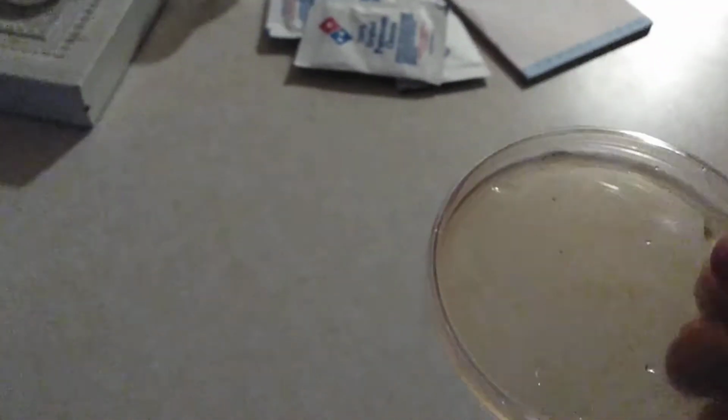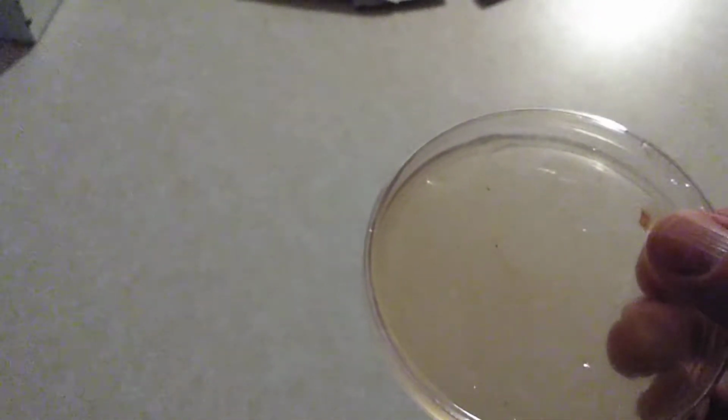You can't streak grow agar onto a liquid form. So that's going in the trash. But when I added a whole packet and I put it in the fridge, it worked great.